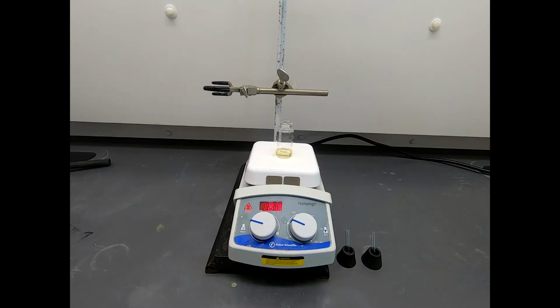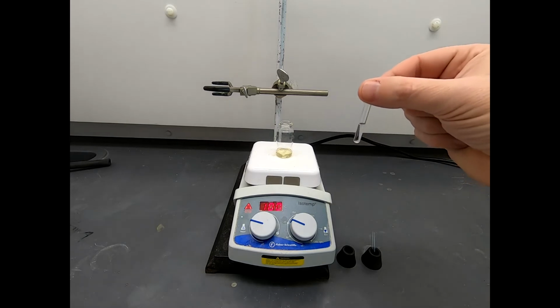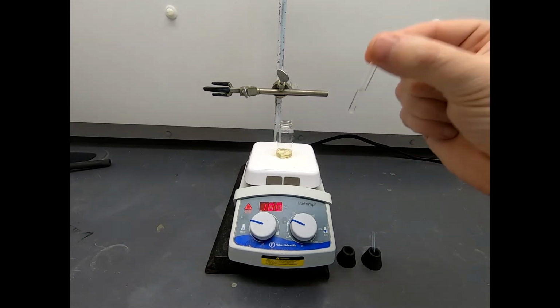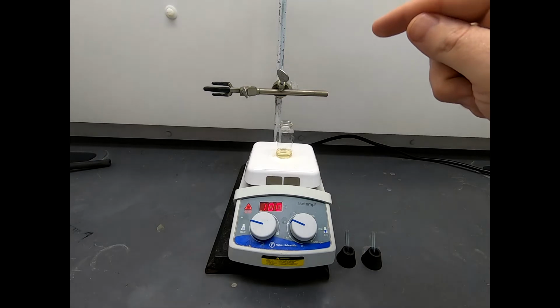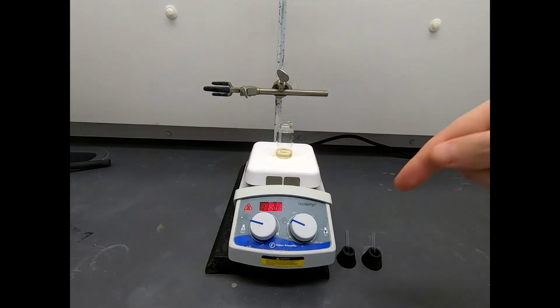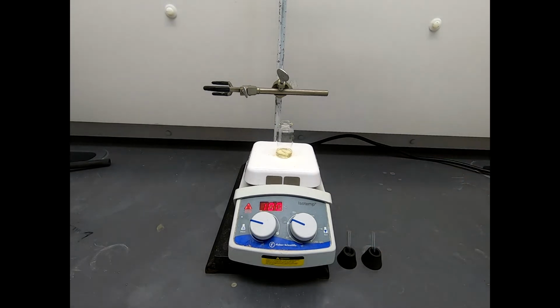So I'm going to go ahead and I'm going to take a TLC of this reaction. And if you notice in the bottom right, we have two tiny test tubes. This is a test tube with a little bit of ether in it and a little bit of our starting material, benzoin. So I have authentic starting material that I can compare to the reaction. And of course, we have whatever's in the reaction mixture. So I'm going to compare the reaction mixture to this authentic starter material in a 3-lane TLC plate.